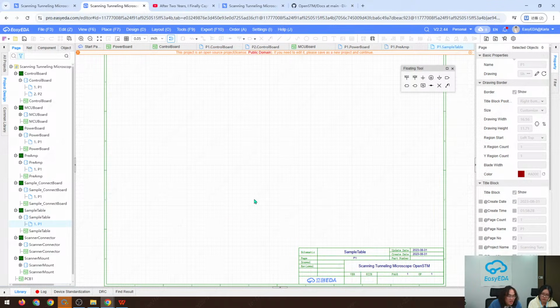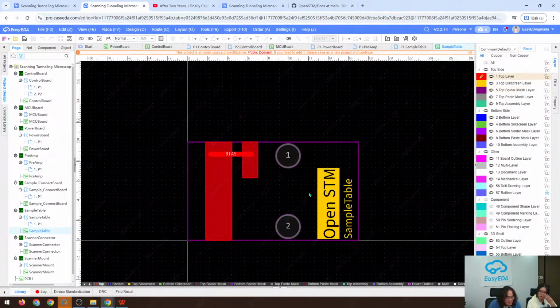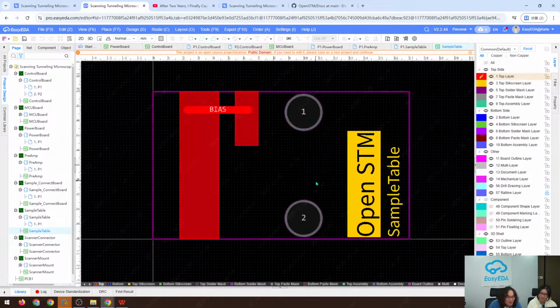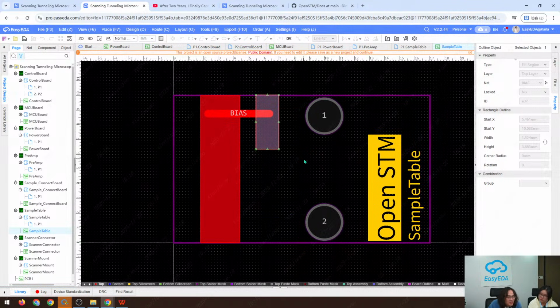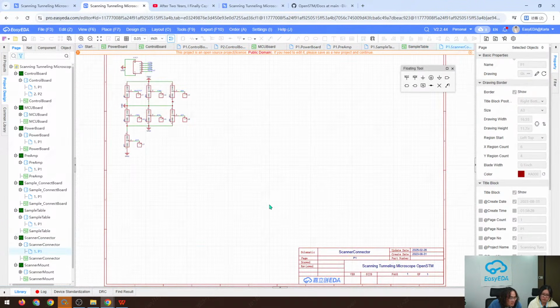And the sample table. You may see that some of the PCBs just act like structural components. The PCB is a very solid material, and we can use it as a structural component. Here we will solder a magnet, so our sample can attach to it. If I explain the details you will be confused, so I'm just showing some of the design here. And the scanner connector is just for connecting.